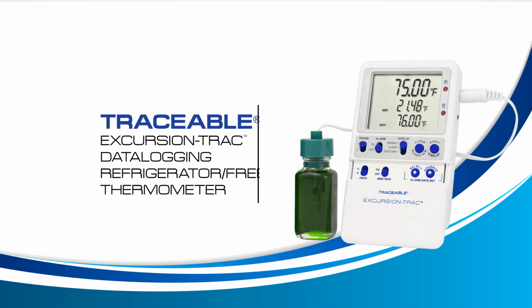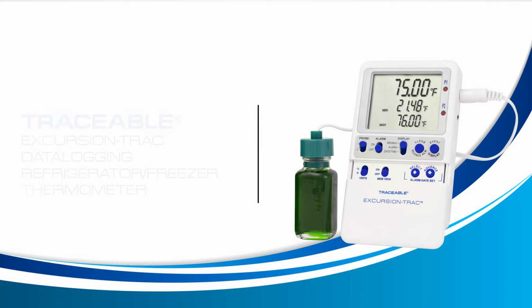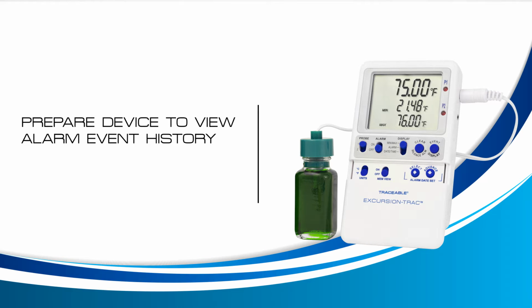Welcome to a Traceable Products instructional video for the Traceable Excursion-Trac Thermometer. In this video, we will prepare our device to view alarm event history, and then view our alarm event history.